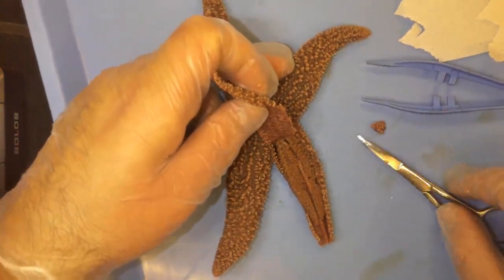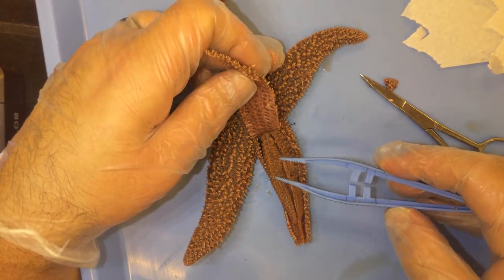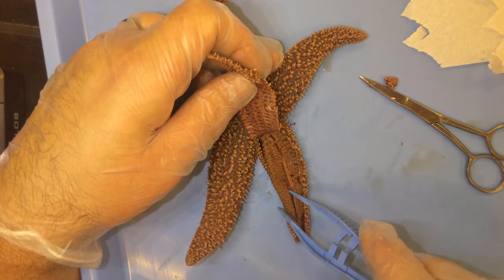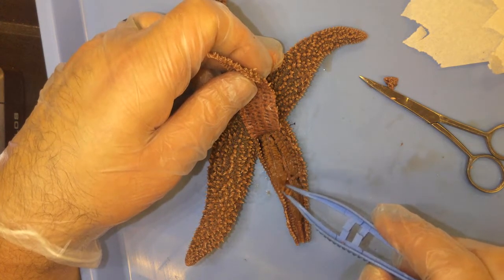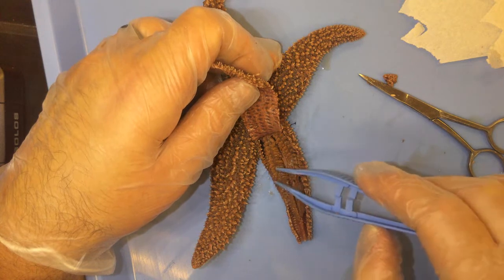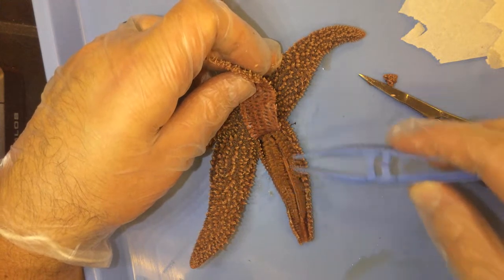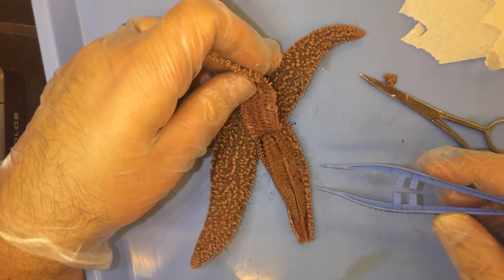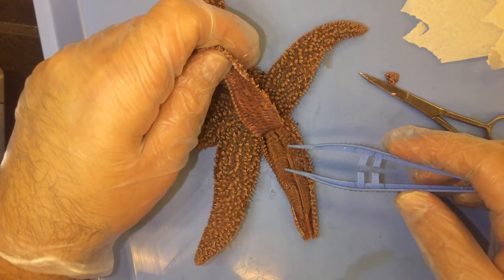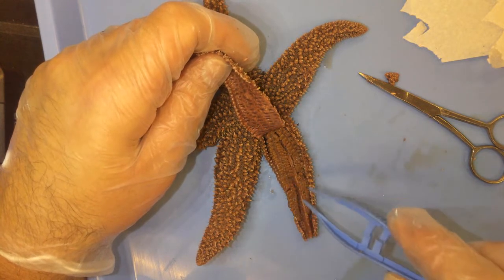Let's go ahead and hold the skin back. What we're going to immediately see once we expose the inside of the sea star are these two yellow-looking organs — they're coiled-up structures with a yellowish color. These are the digestive glands, otherwise known as the pyloric caeca. What these digestive glands do is make the enzymes, which are sent to the stomach so that the stomach is able to digest and break down the food that it eats. These glands aid in digestion.